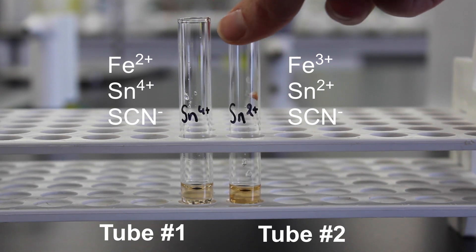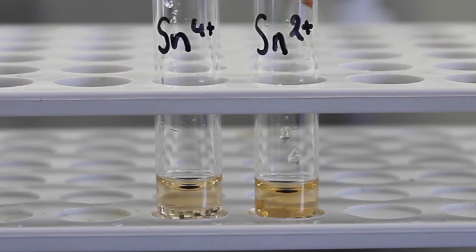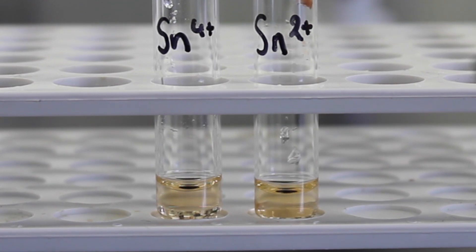Remember that thiocyanate ions only tell us whether or not iron 3+ is in the solution. Whether that means a reaction has taken place depends on what you put into the test tube to begin with. Take a moment to think about what your results mean and rank the standard electrode potentials we've determined so far.